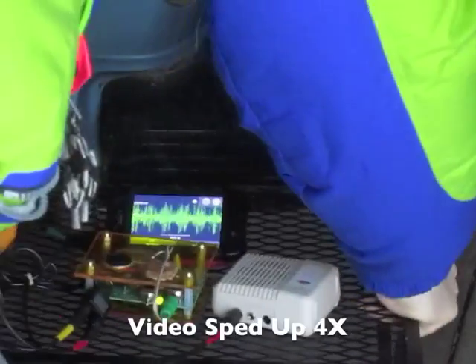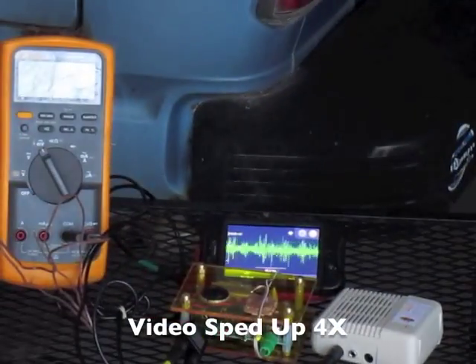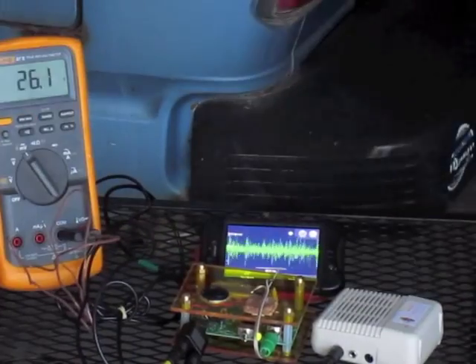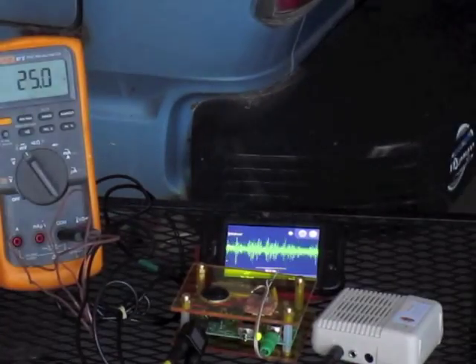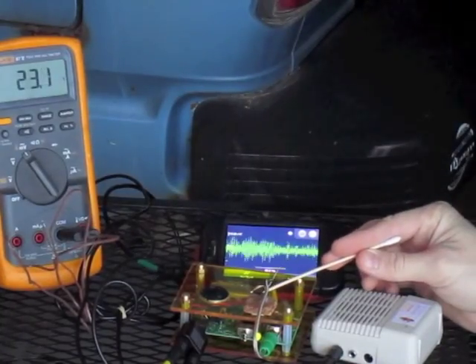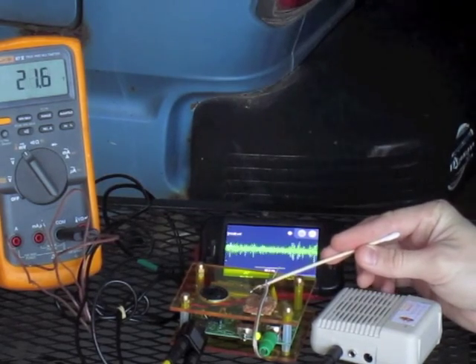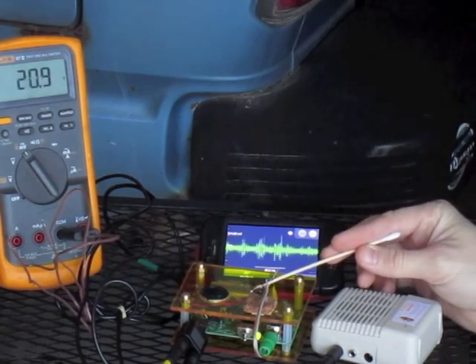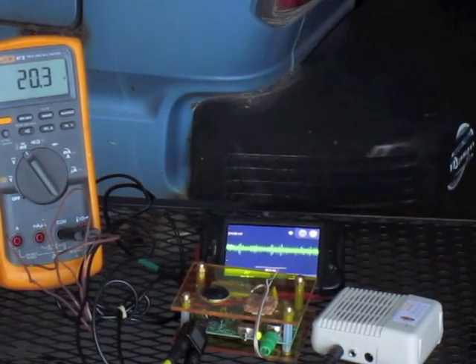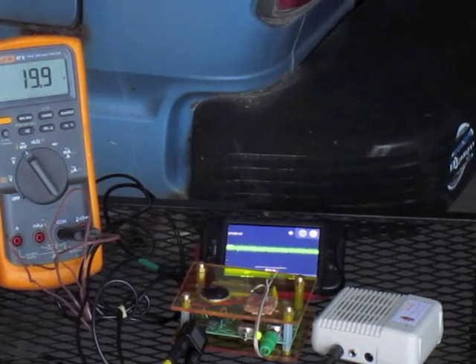Now you can play these cool-down warm-up cycle games over and over again. Here's a sped-up video of me bringing the cockroach leg back into the garage. And again, around 20 degrees, the activity disappears.